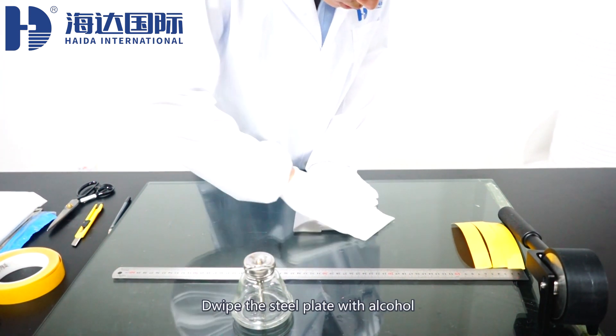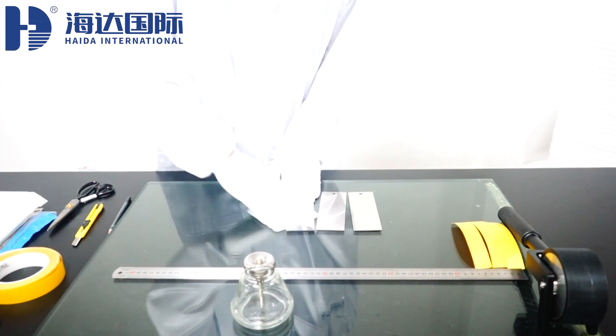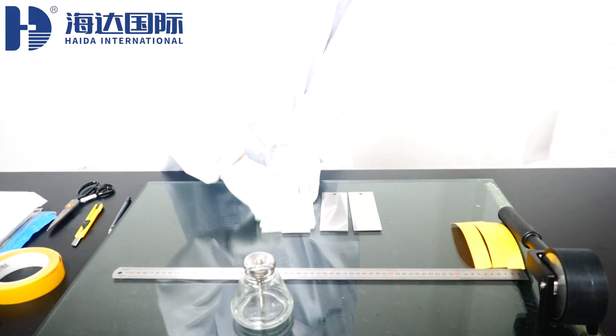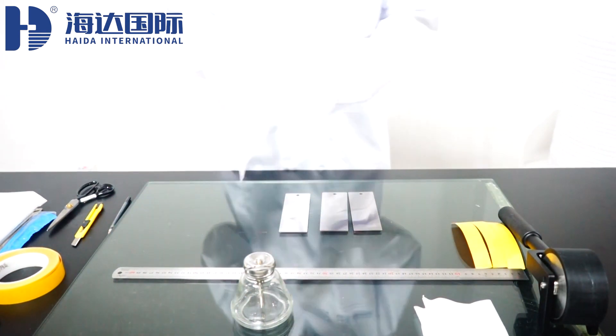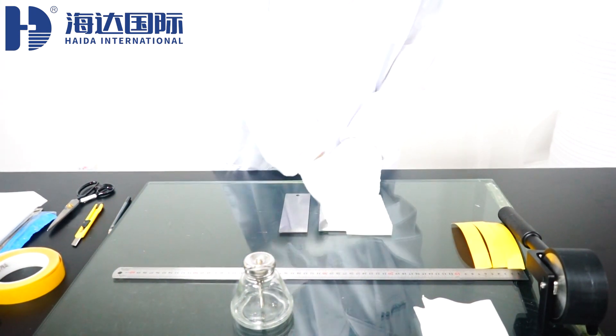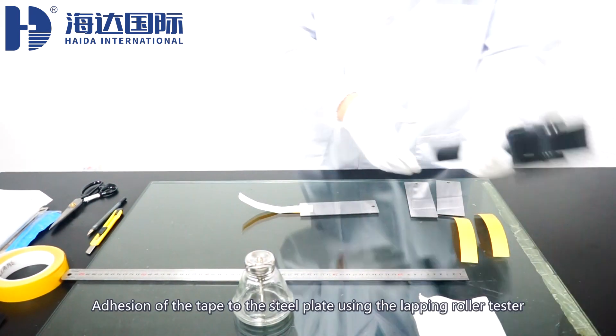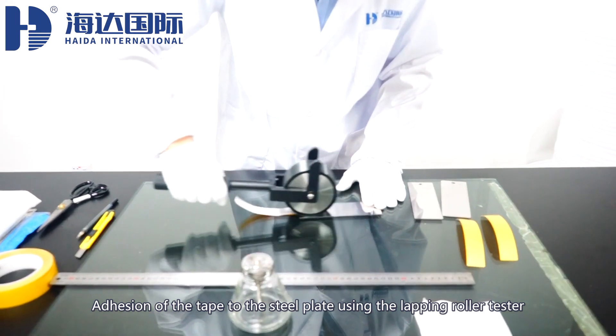Wipe the steel plate with alcohol. Adhesion of the tape to the steel plate using the lapping roller tester.